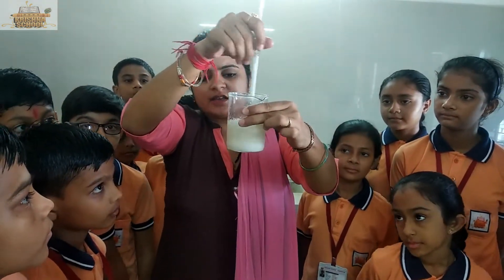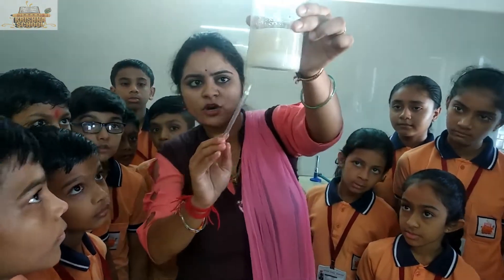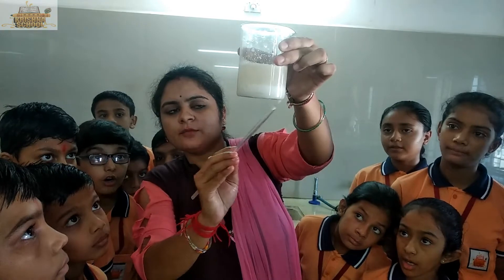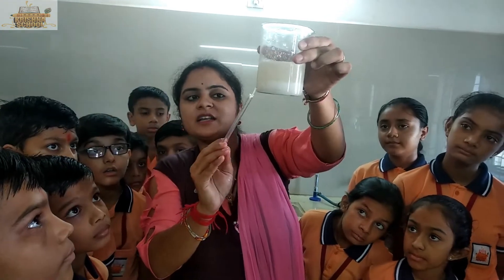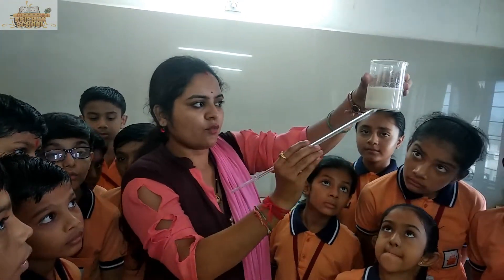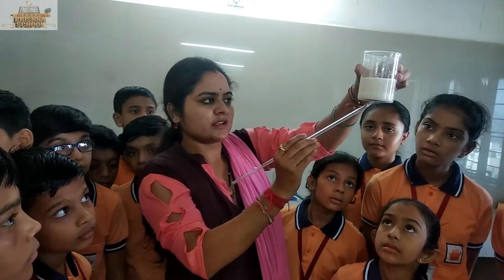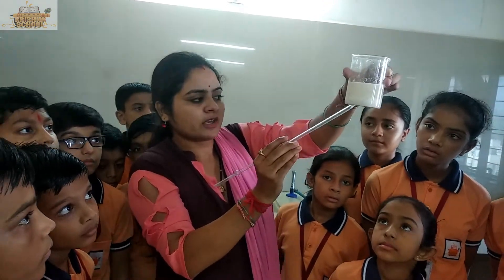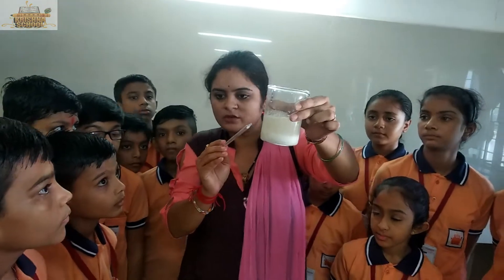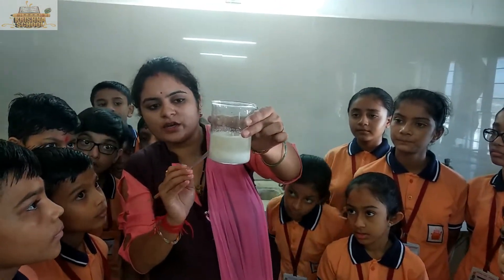Now you can see so many salt particles are settled in the water — these particles are not dissolving. Means the quantity of solute is not dissolving in the solvent. Water is a universal solvent, ma'am.